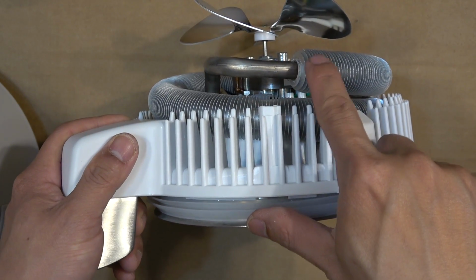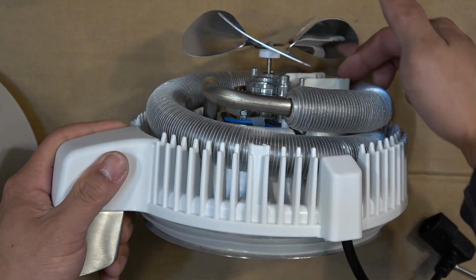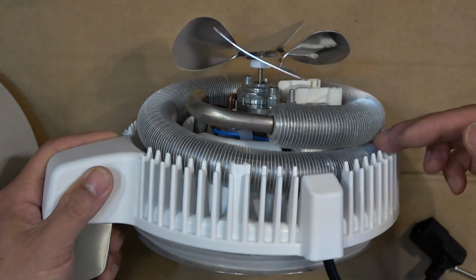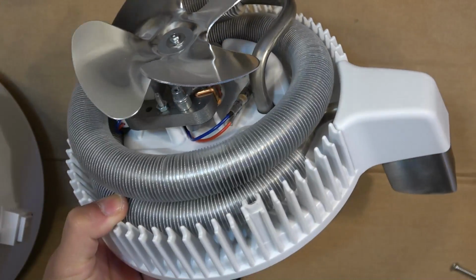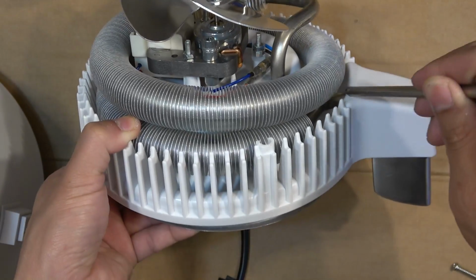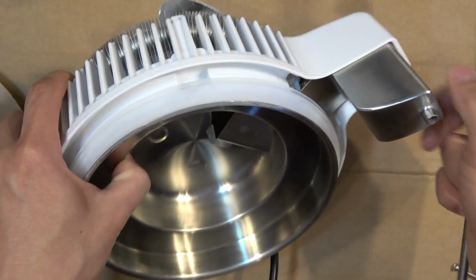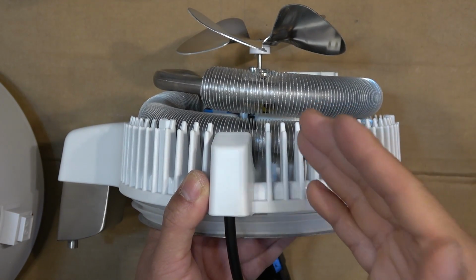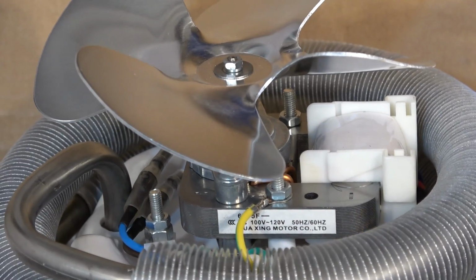This is where the vapor starts to condense, and then gravity will take over and pull it down. So this spirals downward, down and down, continues to go down all the way until it gets to here, and then the coil goes straight down and down the spout. So this cooling system is also very simple. It runs by gravity. There's no pump or any electronics at all besides the fan. And let's take a look at the fan here.